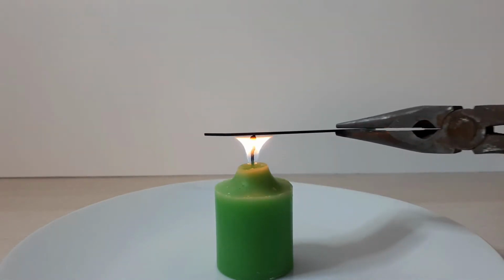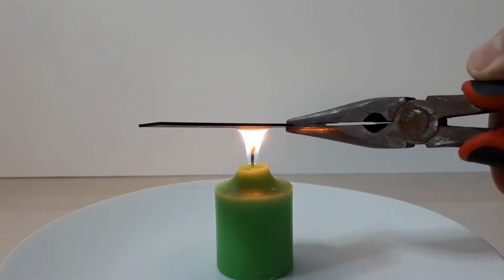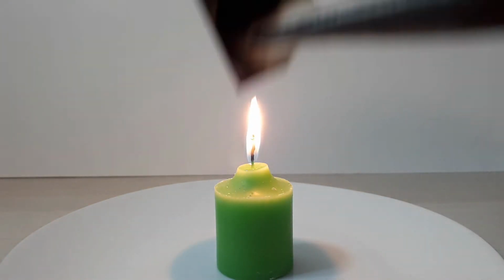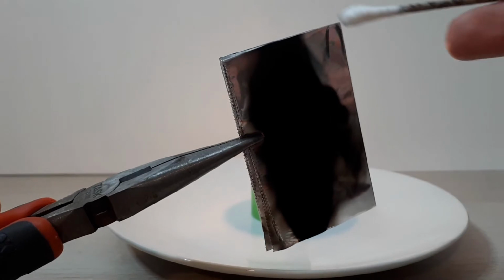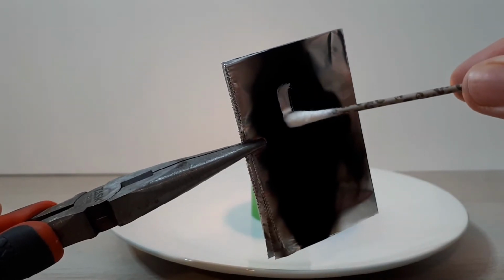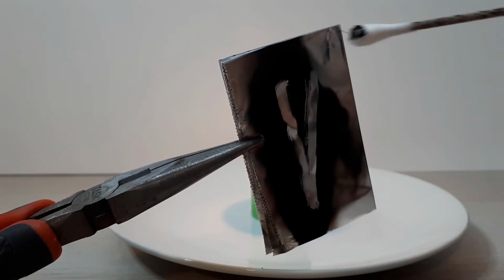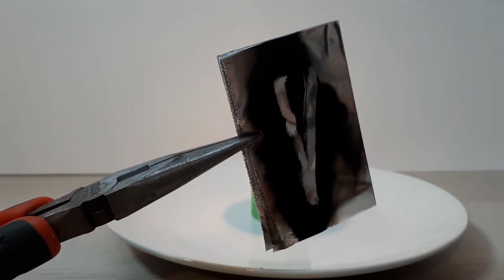The difference in film thickness can be observed here. As the glass slide is moved up and down, the candle flame is completely obscured by thick deposits and simply dimmed by thin deposits. Unfortunately, the adhesion of this film is very poor, so it would have to be stabilized with an adhesive or epoxy. Alternatively, it can be removed completely, mixed into a paint or other application media, and reapplied.